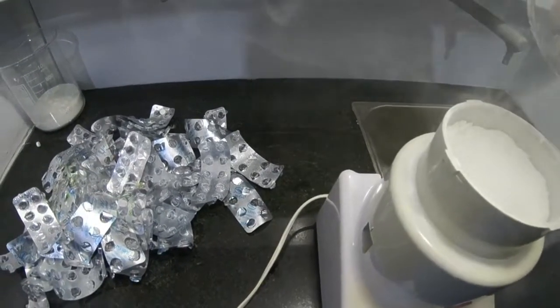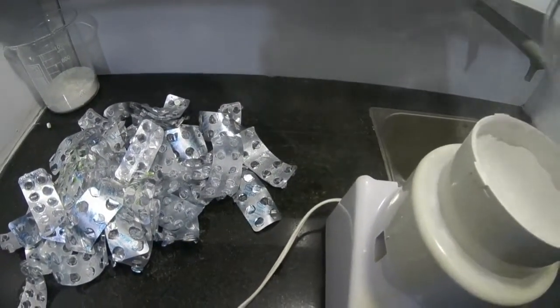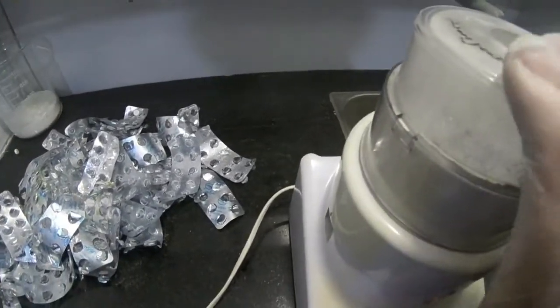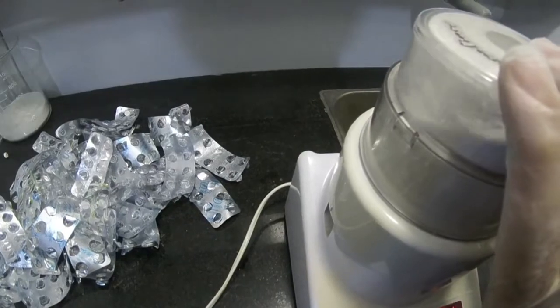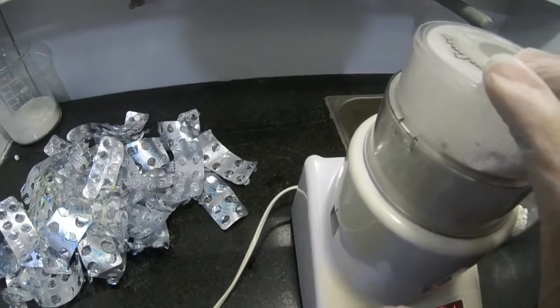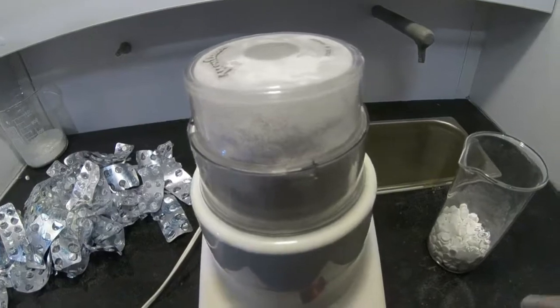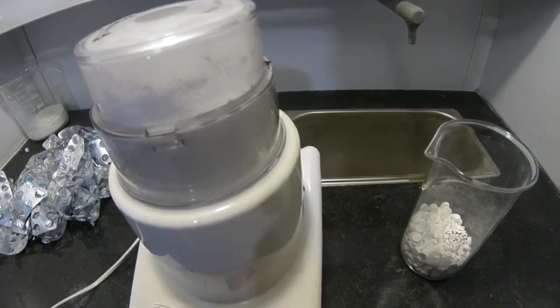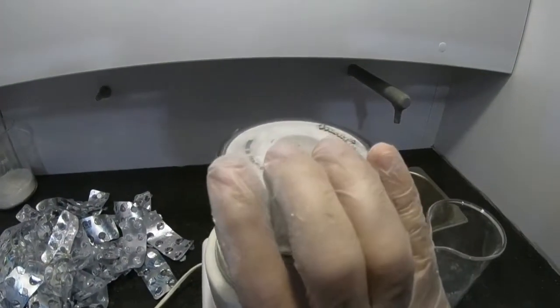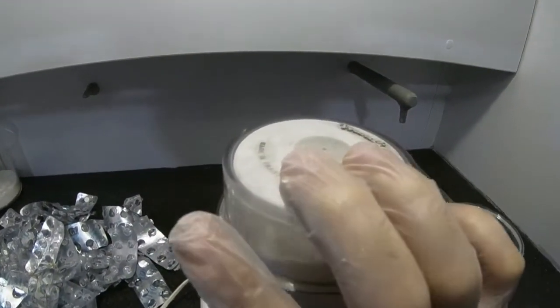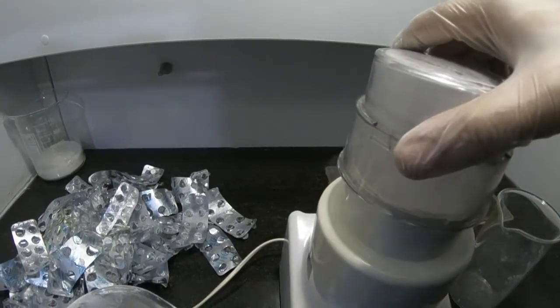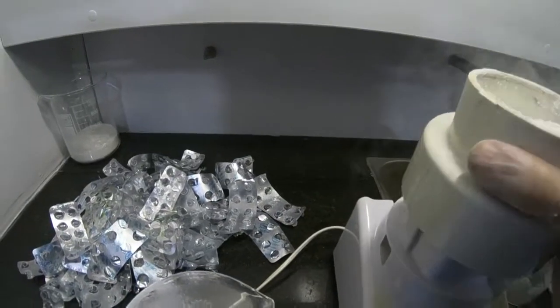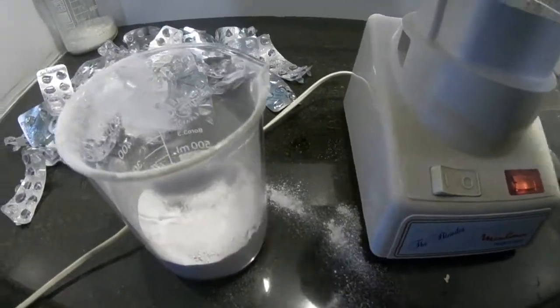That did a good job. I'm going to powderize the rest of them and I will be back. Okay, I powderized all of them. I spilled a little bit of it.